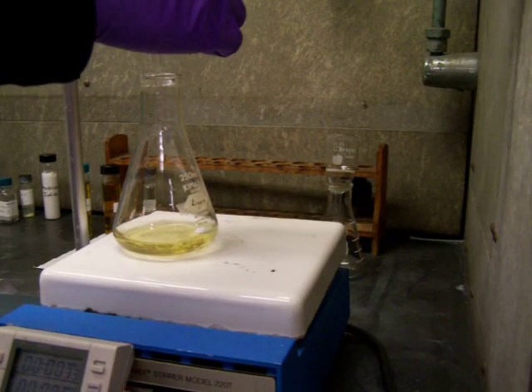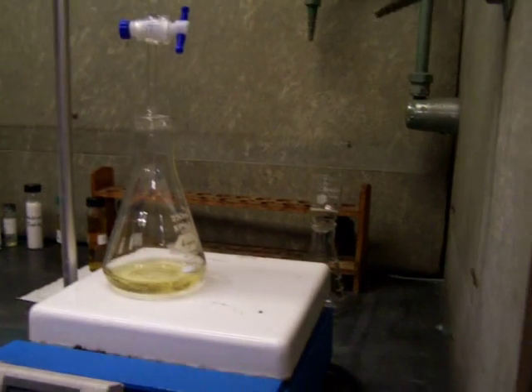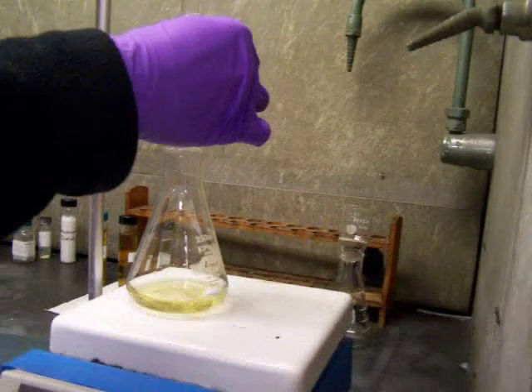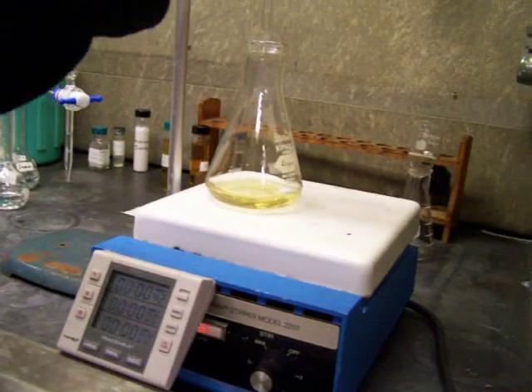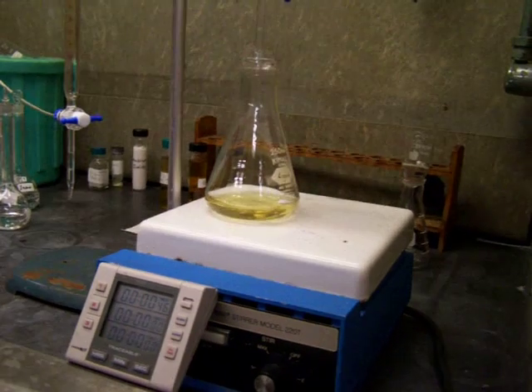Are you moving too fast? Yeah. Okay. Well, that was the problem first. Wait, you dumped too much at the beginning. So that's why your reaction was too fast.